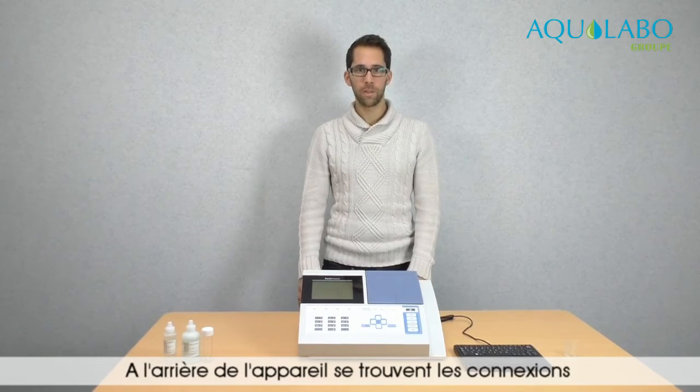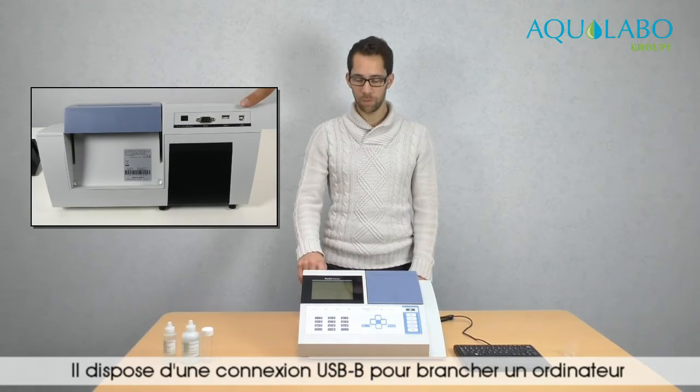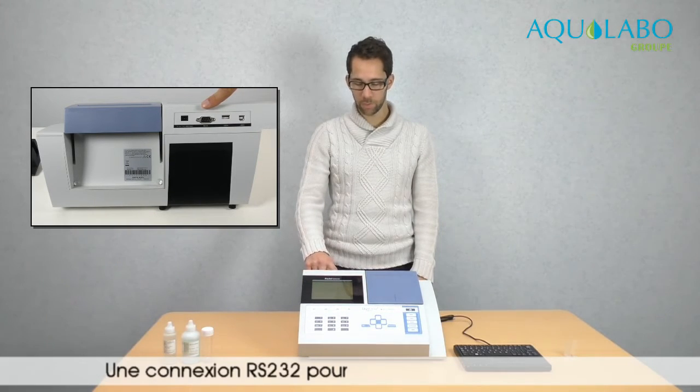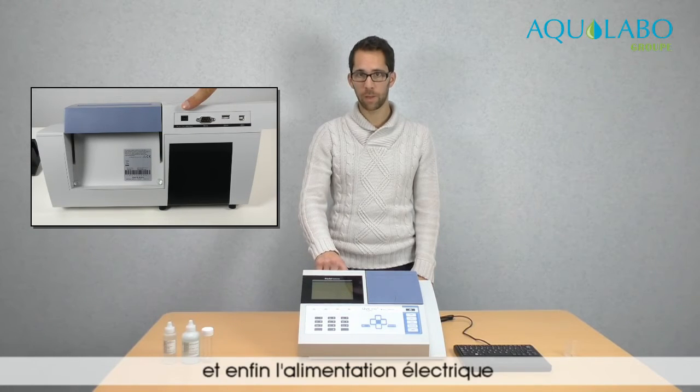At the back of the device there are the connections. There is a USB-B connection to plug a computer. There is a USB-A connection to plug a keyboard or a USB stick. There is a RS-232 connection to plug a printer, and there is a power supply.